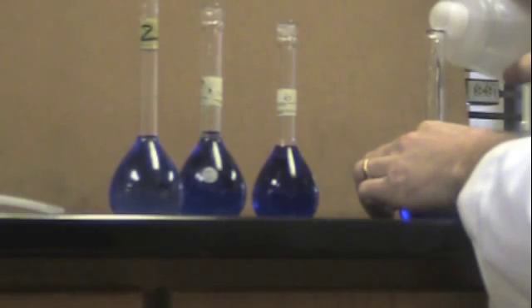So be very careful when you get close to the mark. You just add water until you get to the 100 milliliter mark. And sometimes these bottles squirt out kind of slow. So if you're careful you could pour. But once you get close to the mark you have to go extra slow. Once it gets into the neck of the bottle it will go pretty fast. So I'd recommend using the squirt top when you get into the neck of the bottle. Remember to use distilled water.